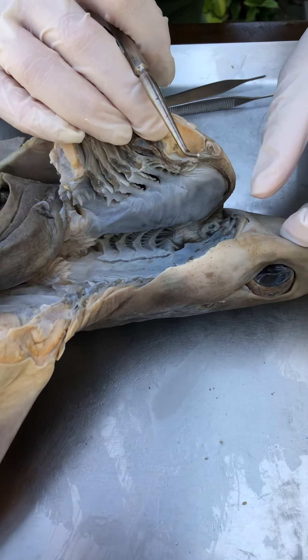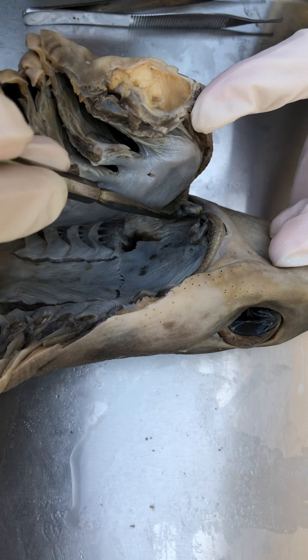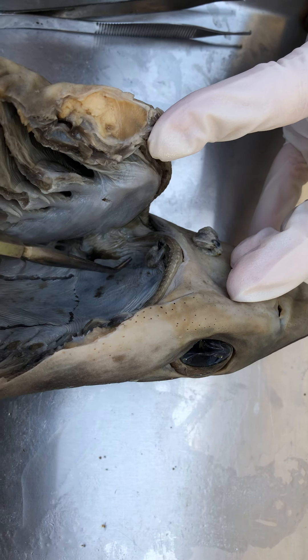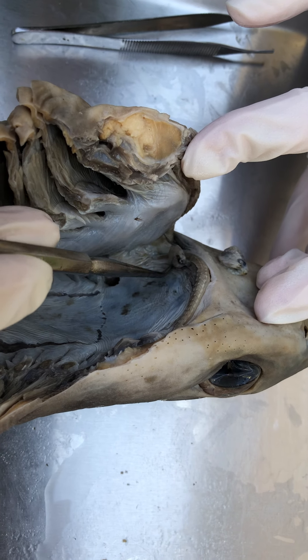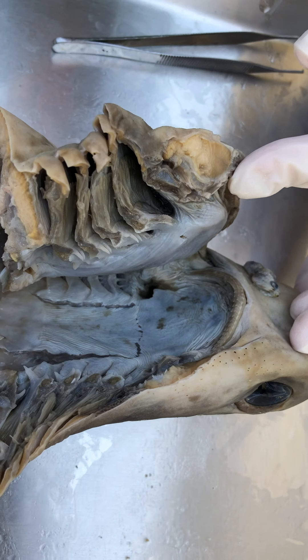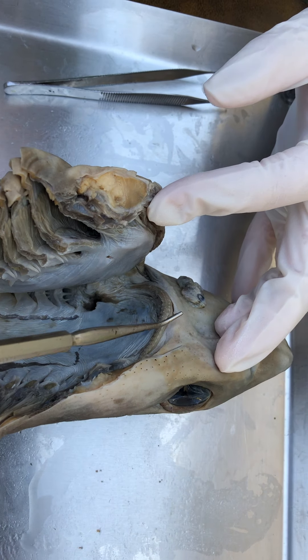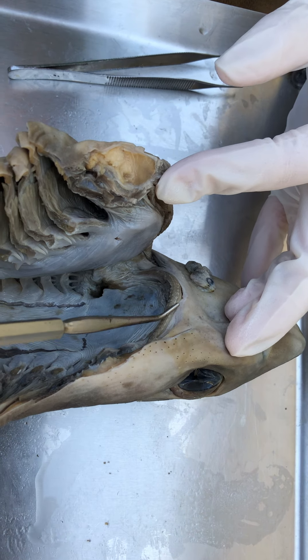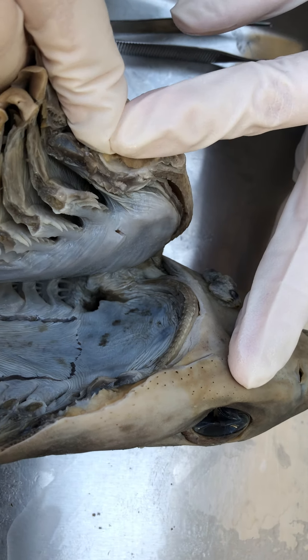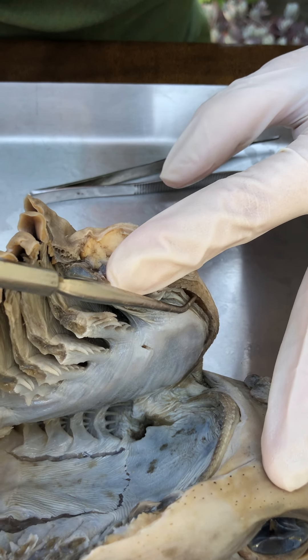Inside of the mouth — a couple of fish heads in there. You'd expect to find fish heads in the mouth. Rows of teeth on the upper jaw and on the lower jaw, and you've got to be careful about those. They are super sharp.